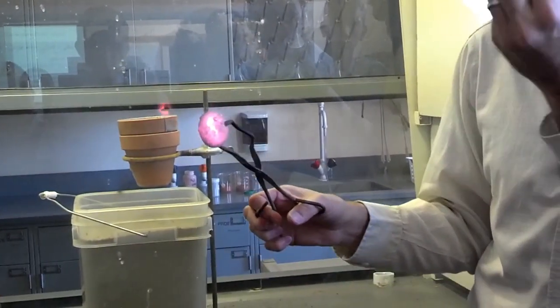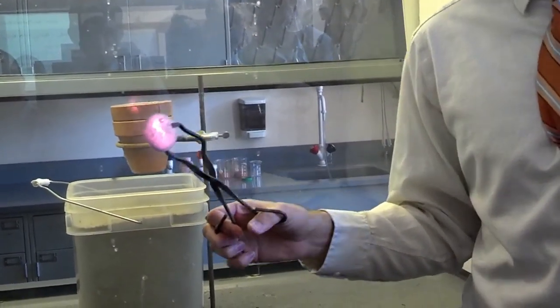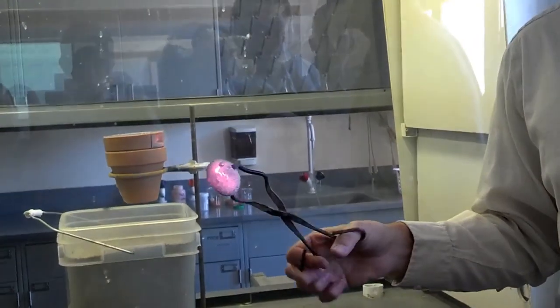Yeah, I cracked the other one open and inside is your little iron egg. I'm going to show you what that looks like. In fact, let's go back over there.